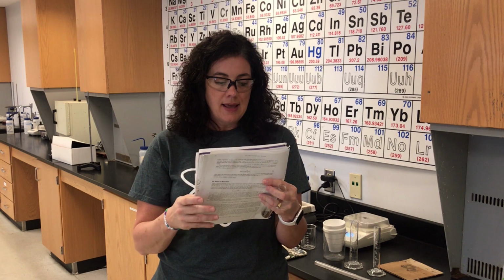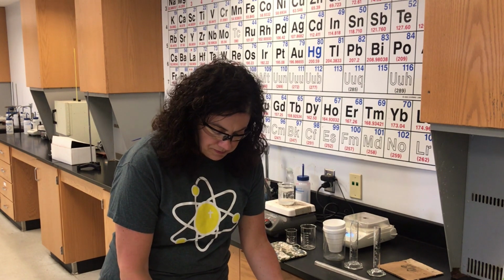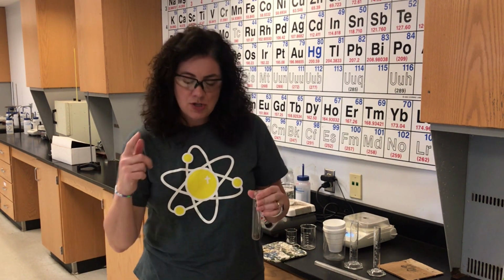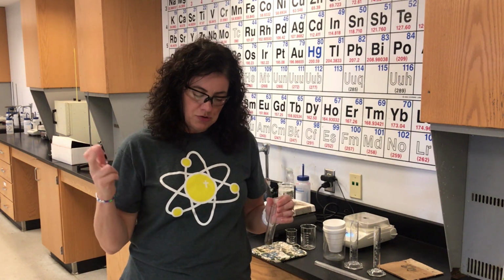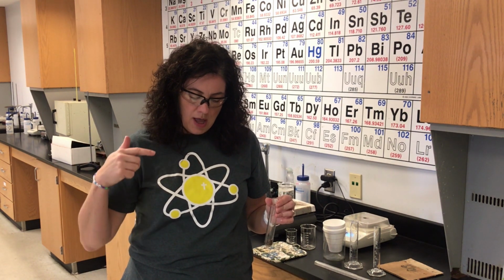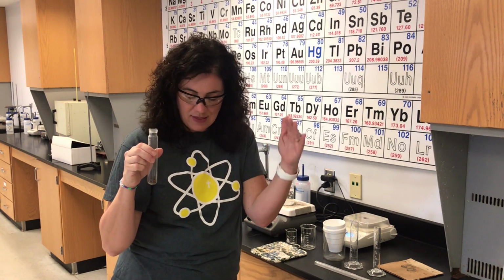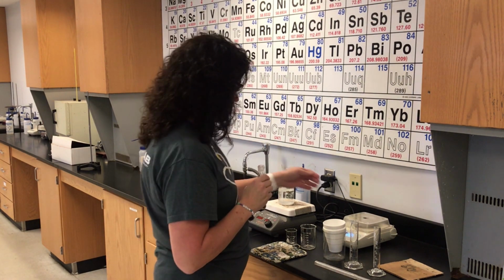While the water's heating, we're going to weigh our sample of the unknown metal. As I do these masses, you need to be on page 101, because that's where you're going to record your data. I'm going to record the mass a little differently than what the lab has. Do y'all see on page 101 the first 2 entries ask for the mass of the tube with the metal and then the mass of the tube and the stopper? I'm just going to weigh the metal, so we're not going to have anything on those first 2 blanks. I'm not going to weigh the tube.